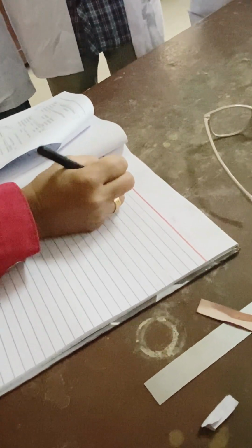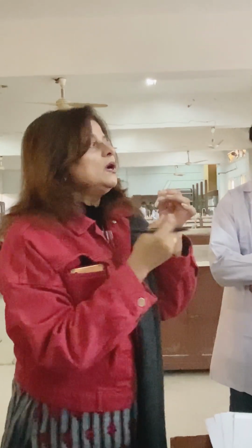Number 6th, solubility test. Now, what is a solubility test? You are going to check the solubility of your compound in different solvents. As I have mentioned, you have to check starting from distilled water, right? First of all, take a small amount of distilled water, that is 1 ml, and put in a few granules of your compound. Try to dissolve it at room temperature. If it's getting dissolved, fine. Just write it down in the observation, getting dissolved. In the results, you write down at room temperature, right?